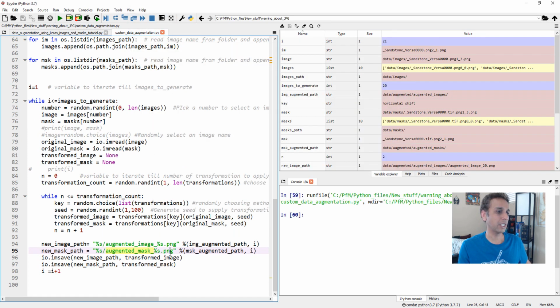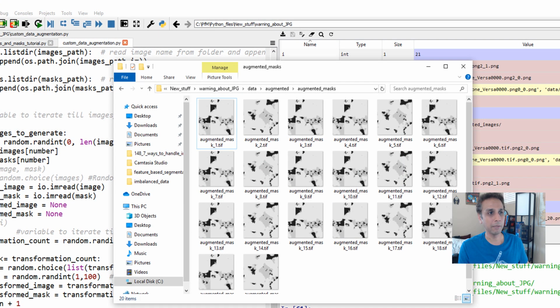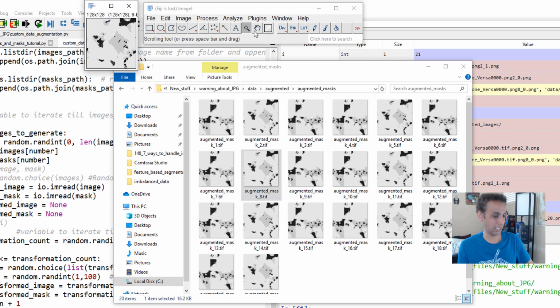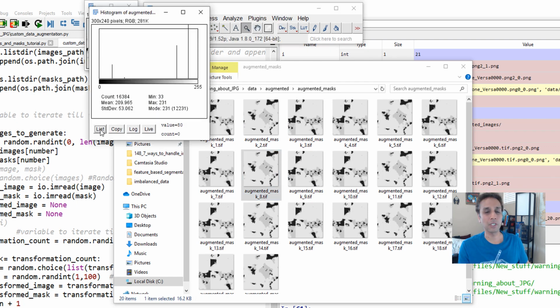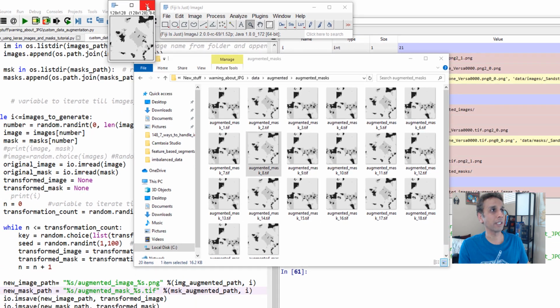Let's close this and delete all of these. Let's change this PNG extension to TIFF. TIFF is even better. I like to work with TIFF files. Now let's open the augmented images. These are all TIFF files. Let's randomly pick one, open it, and look at the histogram. It should look pretty much the same because it shouldn't change my data. There you go, 33, 65 and everything. Now everything is working fine.